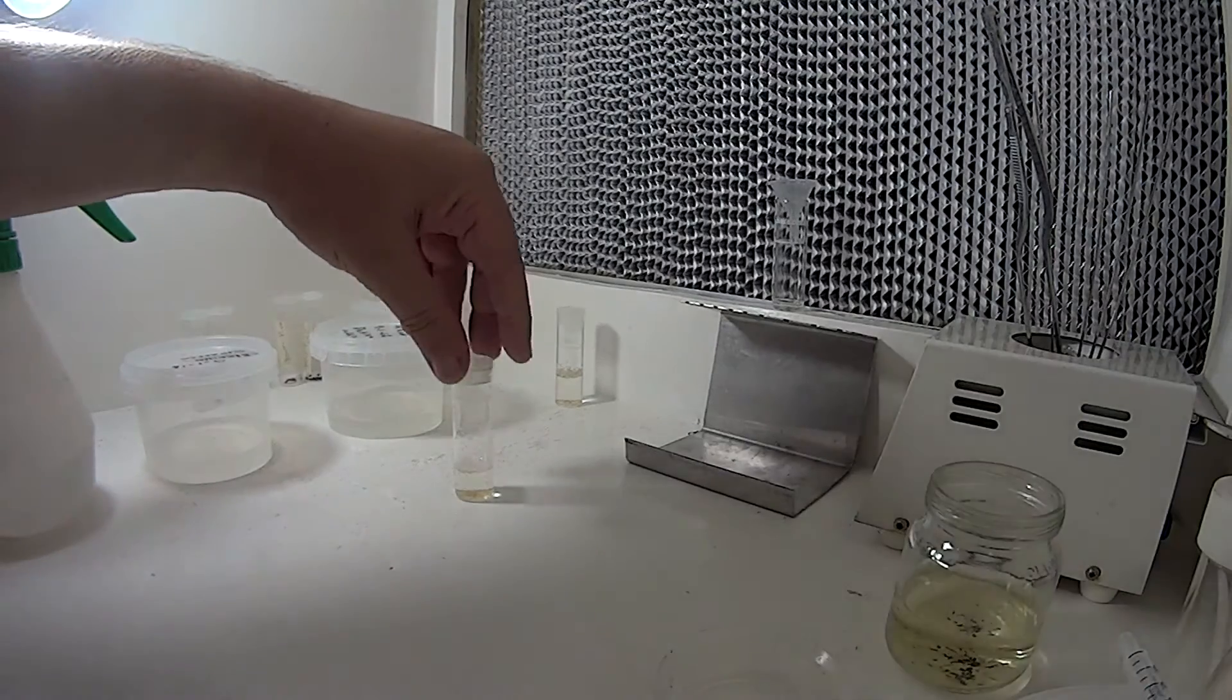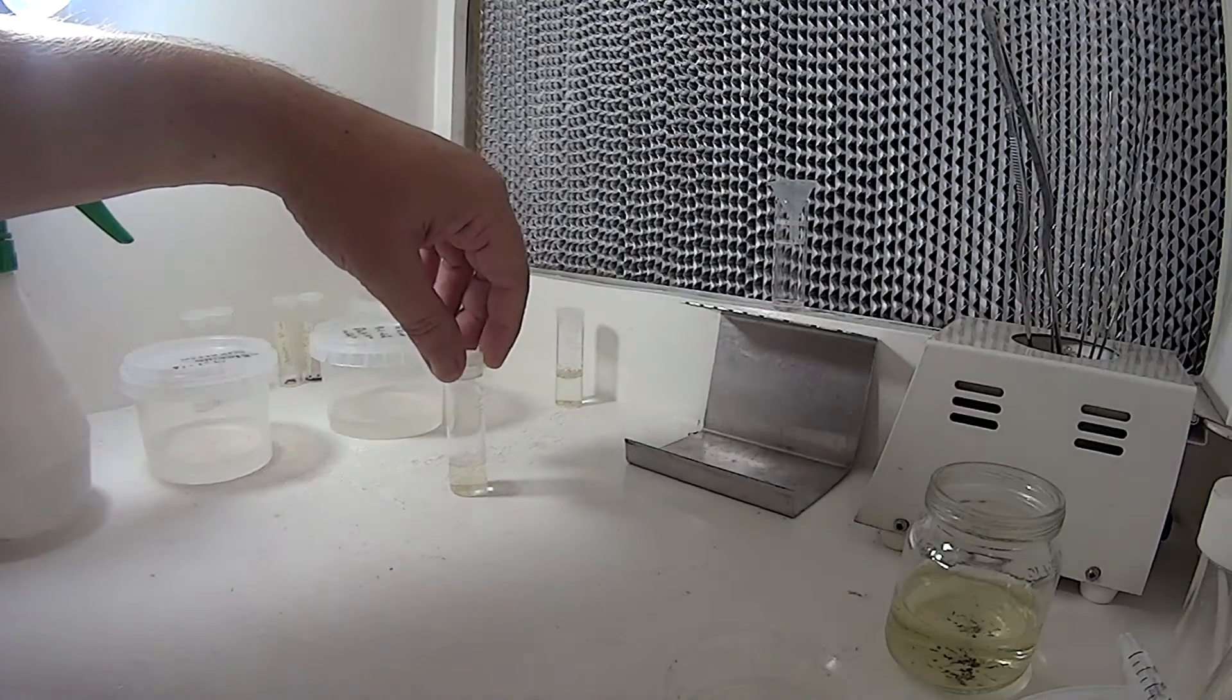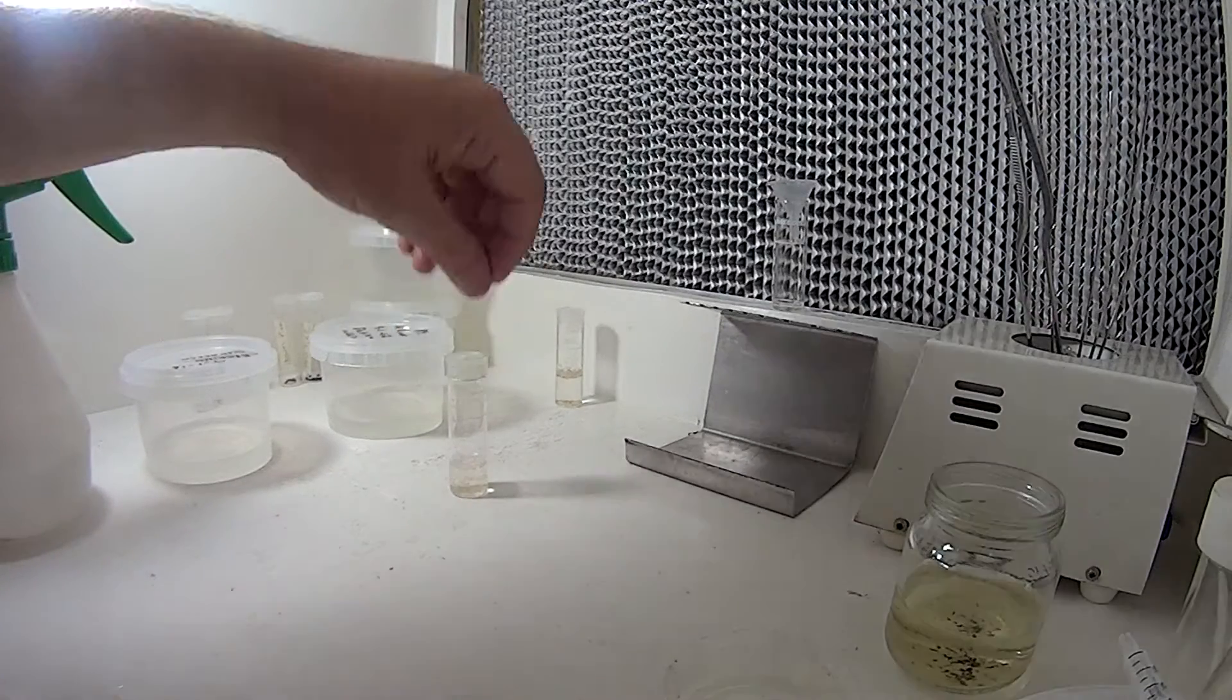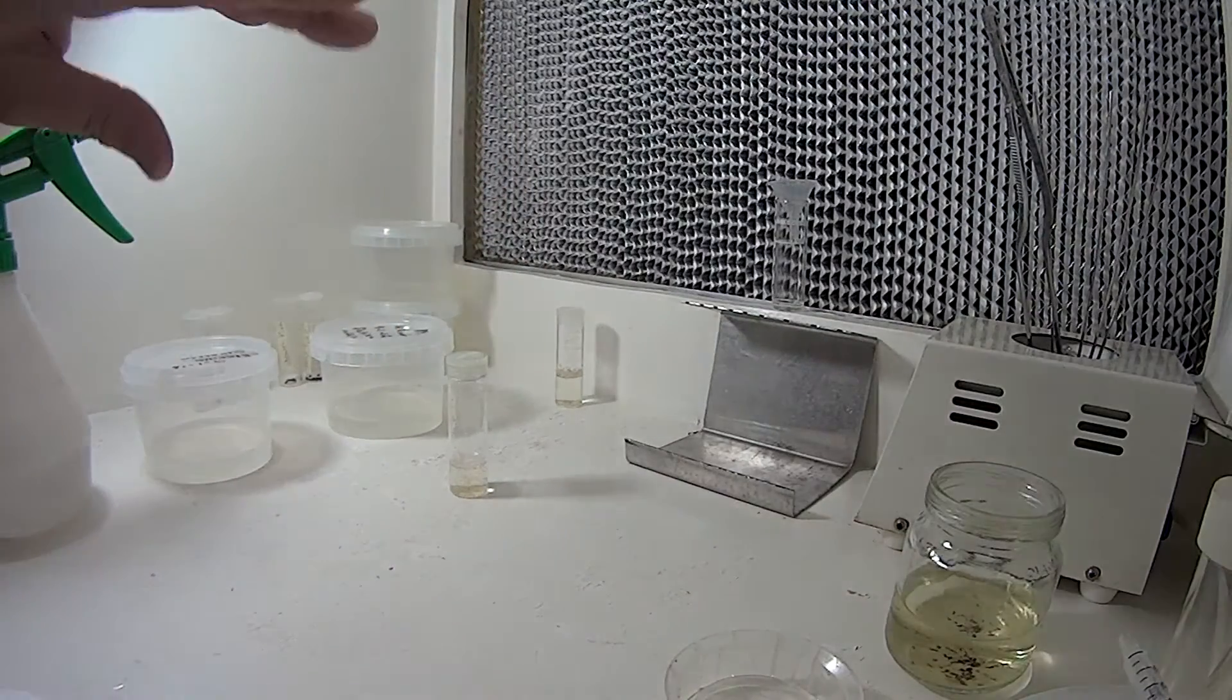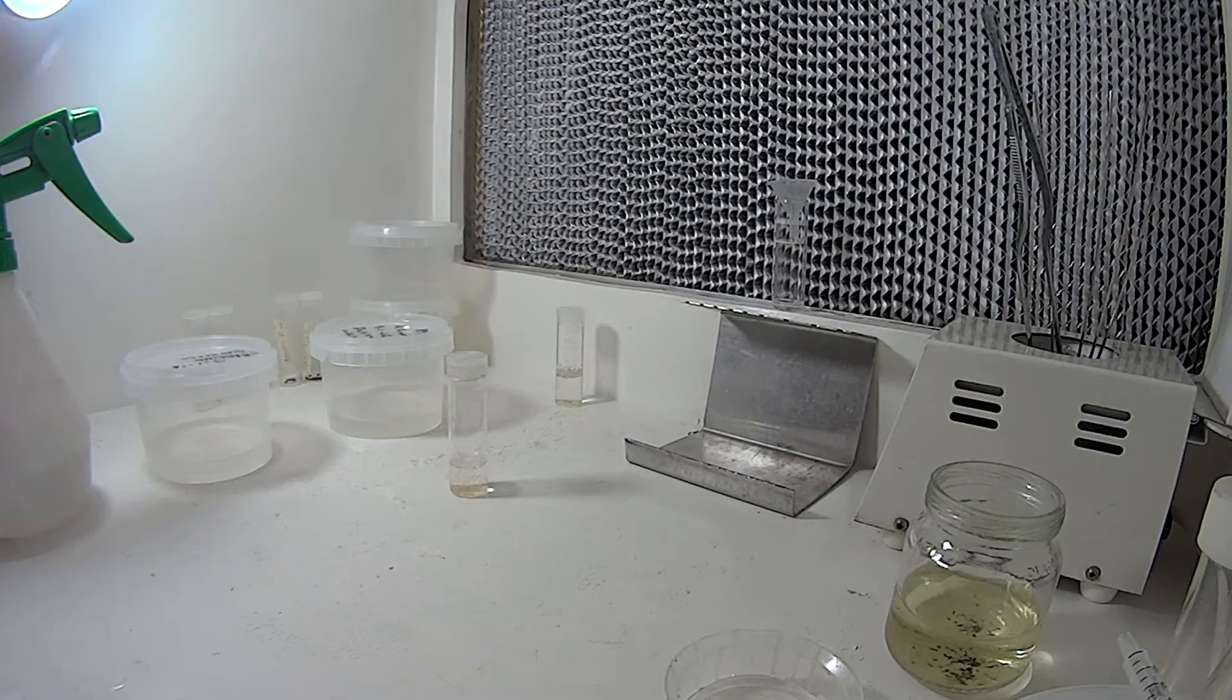And that's a pretty good sterilization solution that I've found, so I'm going to try it on these orchids. These orchid seeds have been in here for about three to four hours now. I'm just going to filter them out and try that, see how they go.